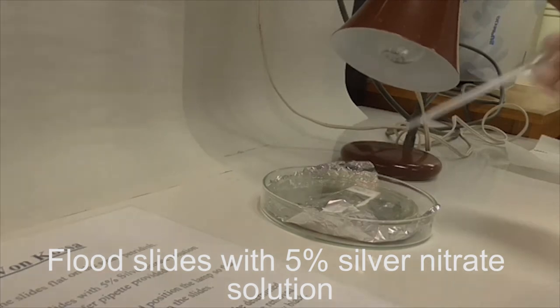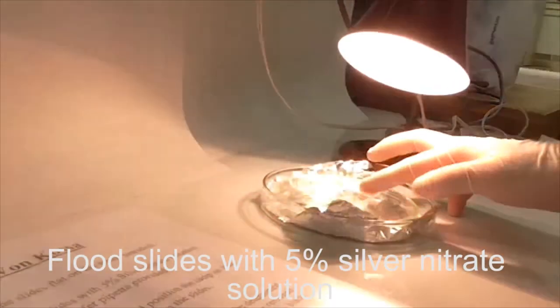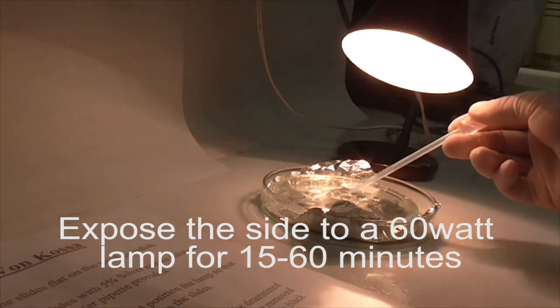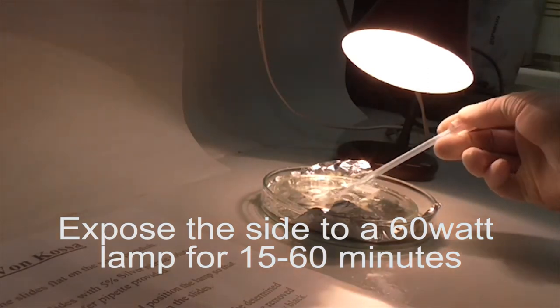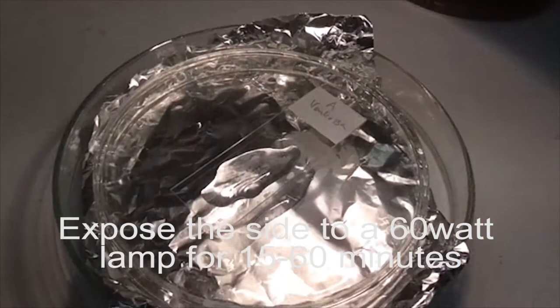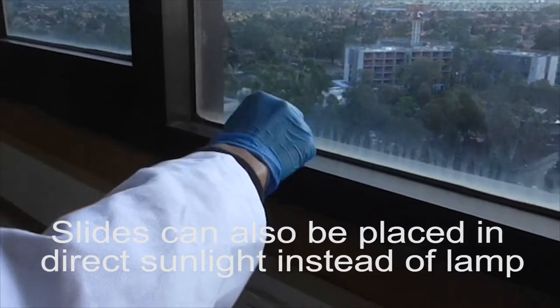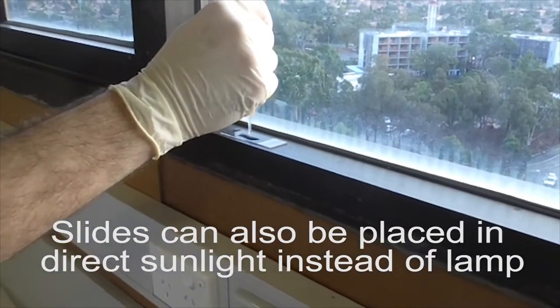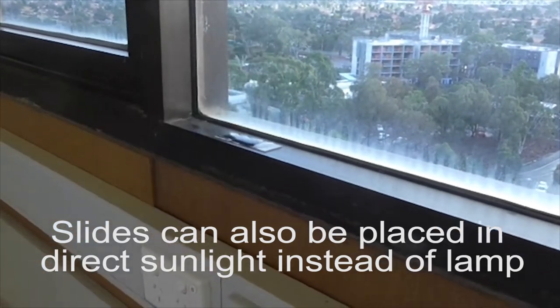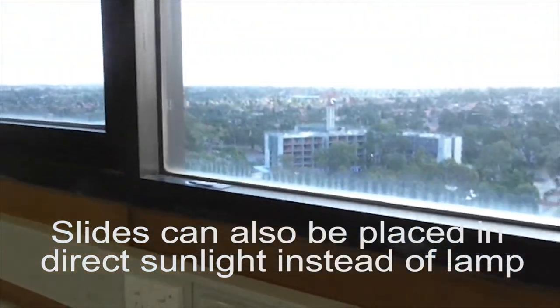Cover the entire section with this solution. For this first experiment, we will be using a 60 watt lamp. Check every 15 minutes for the calcium to turn black. We also placed one section in direct sunlight, covered it with 5% silver nitrate solution, and left it there for 15 to 60 minutes until the calcium turns black.